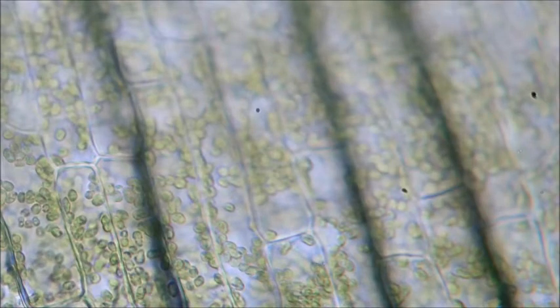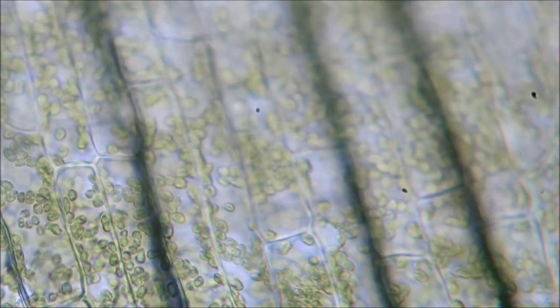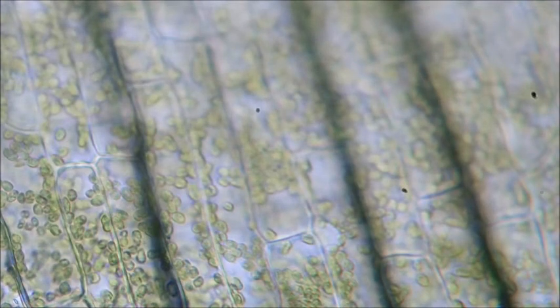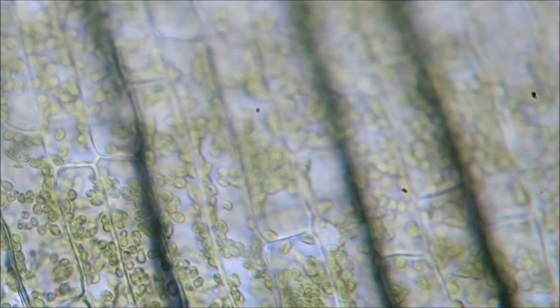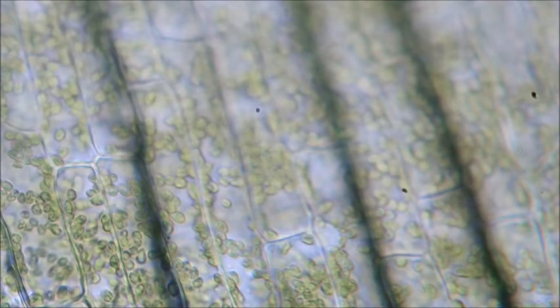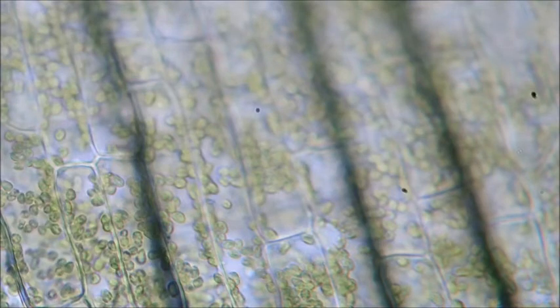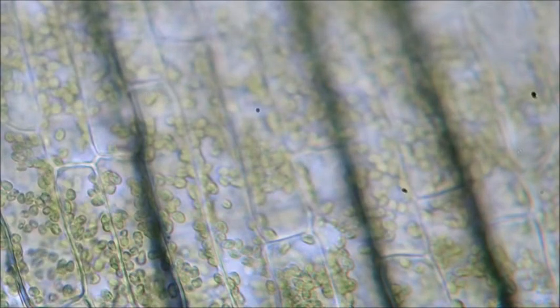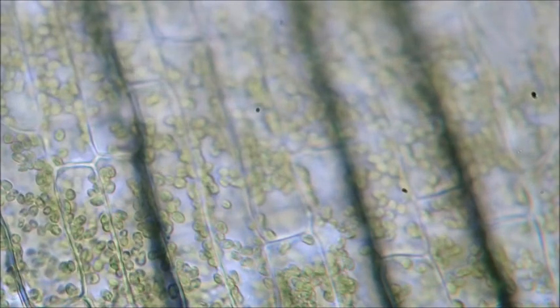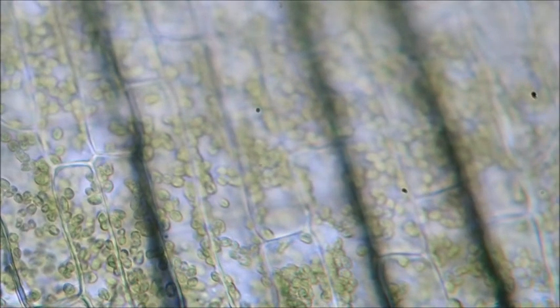Now look down the bottom of the screen in the middle. Can you see those chloroplasts moving? That is called cytoplasmic streaming. So they just kind of flow around the vacuole in the middle of a plant cell. Now, if you've seen plant cell diagrams, you will know that plants have vacuoles, which is a big fluidy sac. Now, in this cell, you can't actually see the vacuole, but it's sort of implied it's there by the way the chloroplasts are dispersed. They all move around this empty space in the middle. It's not actually empty. There's a vacuole there that you can't really make out, but that's why they're moving the way they're moving.